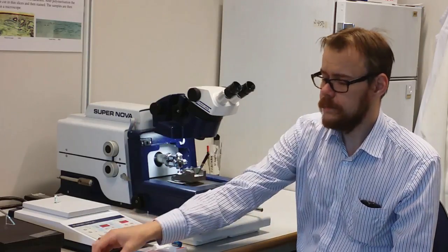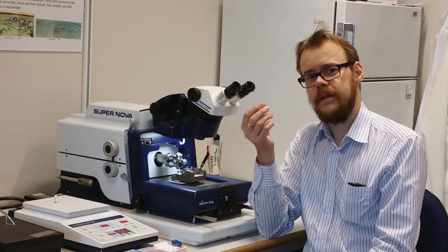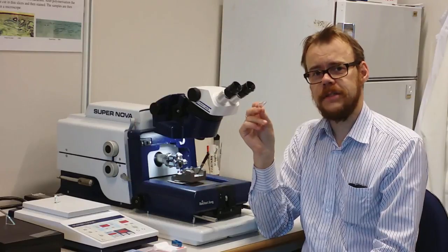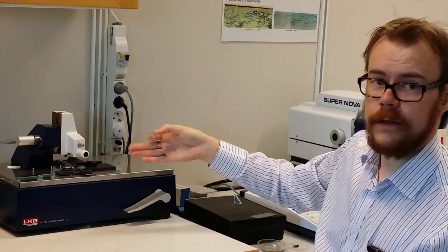To cut the sample you use either glass pieces like this. You know when you break glass you create very sharp edges, and those edges can be used as knives. First you use a machine that looks like this.